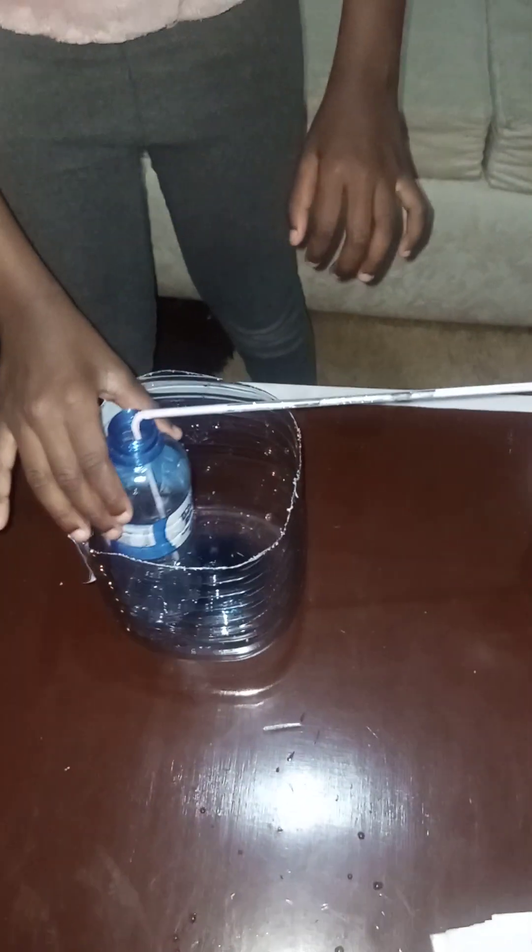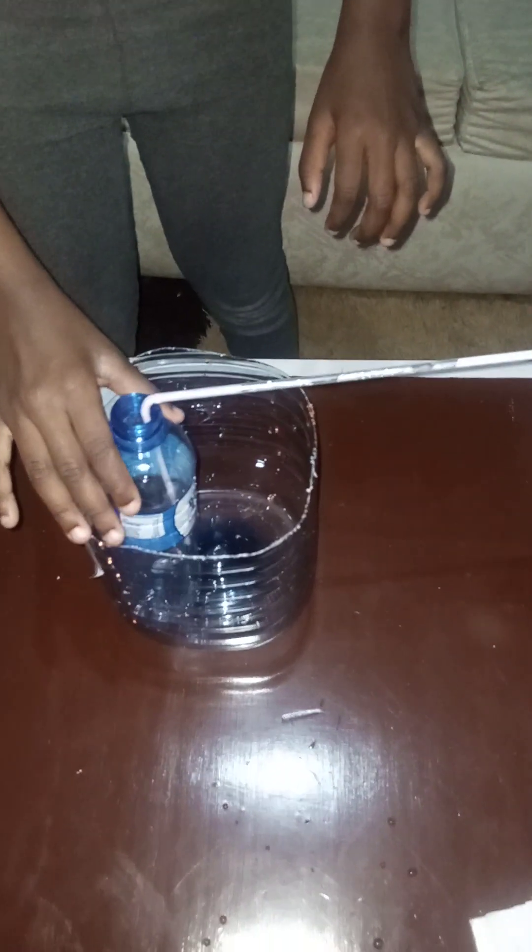We don't have exactly ice water but we will put water at normal temperature into that particular jar. Here this is our arrangement — the setup is almost complete.